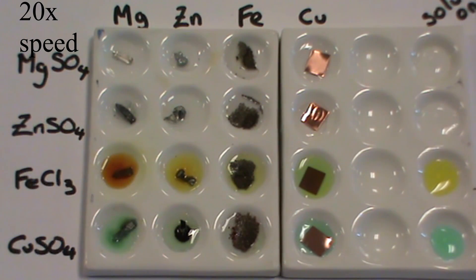Note how the magnesium and iron chloride well has darkened considerably compared to just iron chloride on its own. In addition, the colour of the copper sulphate sample has become paler when displacement has occurred.